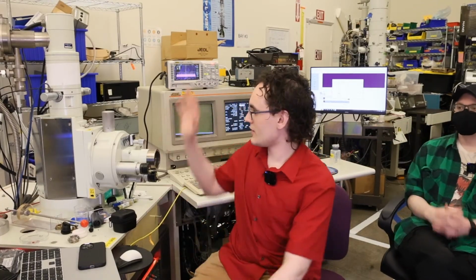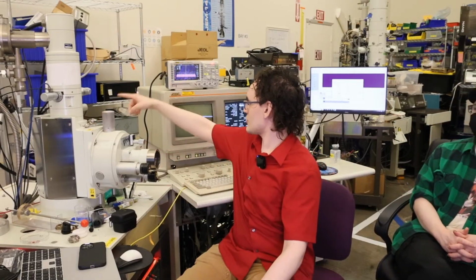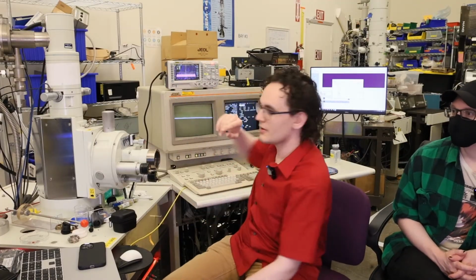We got a JEOL 6400. We've got a Thermo Ultra Dry EDS detector and a Noran System Seven back there. Got a Noran computer. And over there, on a sample prep bench you all haven't quite seen yet, we have all of the wipes that we use to clean out the chamber of the Merlin.